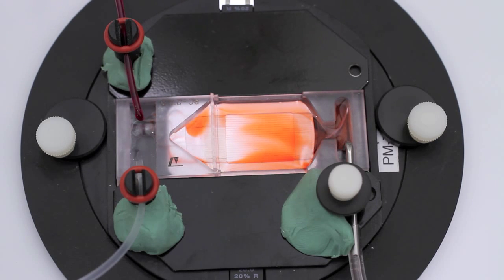Note the position of the perfusion inlet tube, touching the sidewall of the chamber's perfusion inlet. This minimizes mechanical perturbations associated with dripping solution directly into the bath.